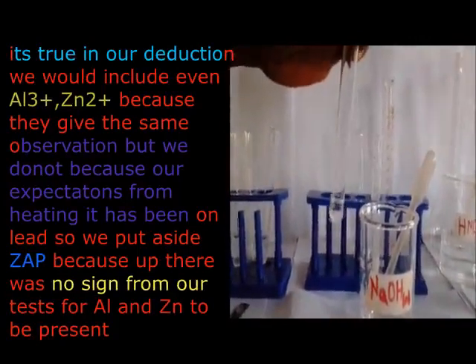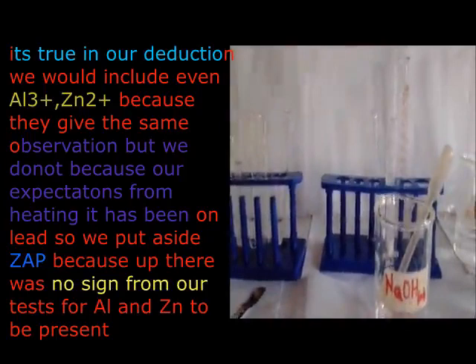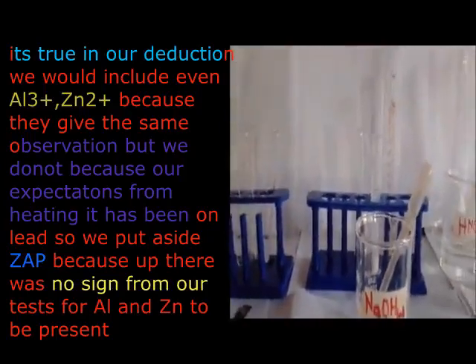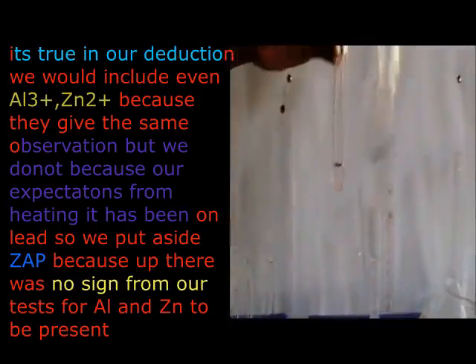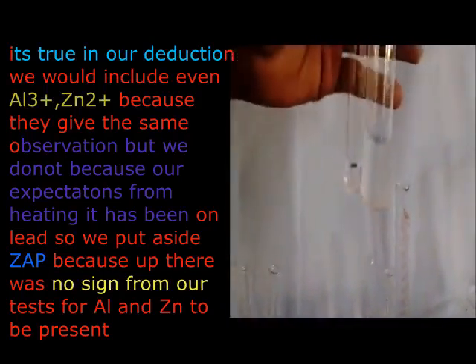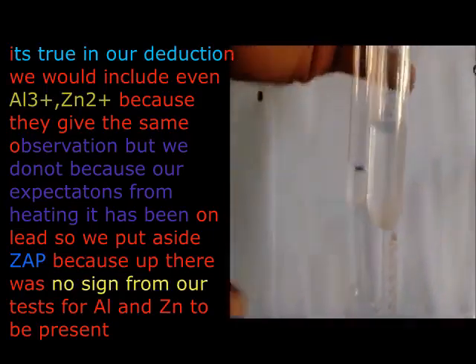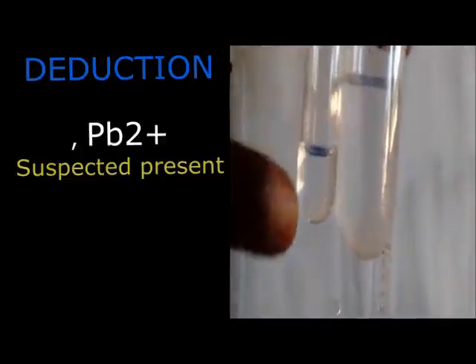You are going to discover that what you have recorded up there, where we are coming from, is going to guide what you record down here. Up there we have not recorded our last test. We have considered lead. Why? When we were heating, there was no evidence of zinc and aluminium.